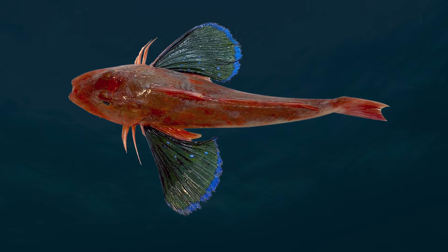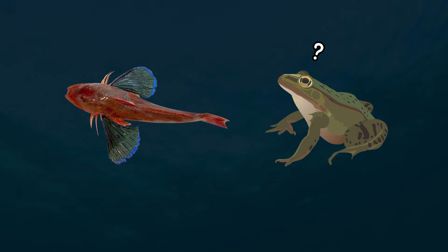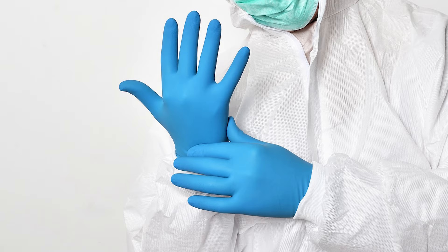Next, let's focus and listen carefully. They produce a unique sound similar to that of a frog. To understand how they generate these sounds, we will dissect them.